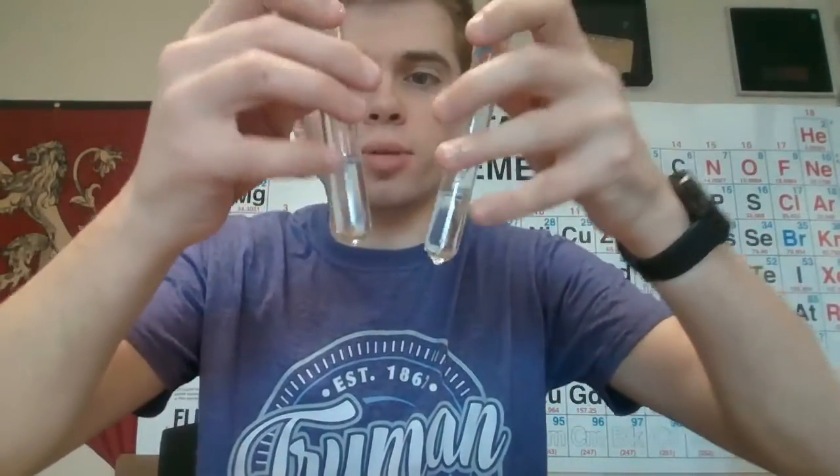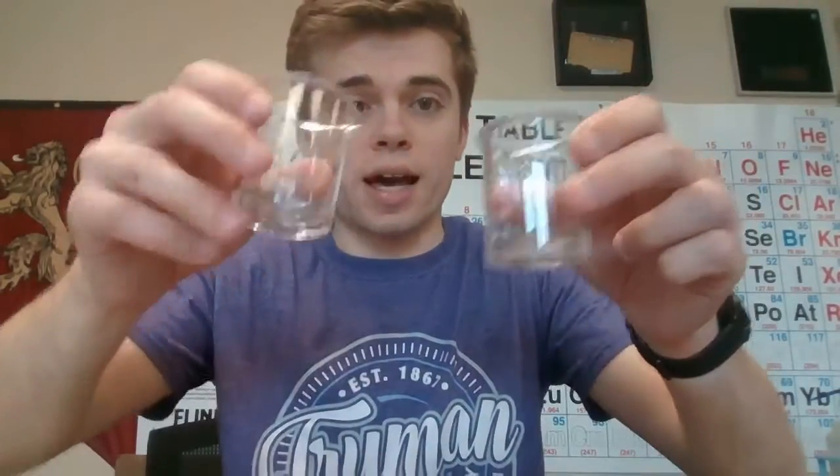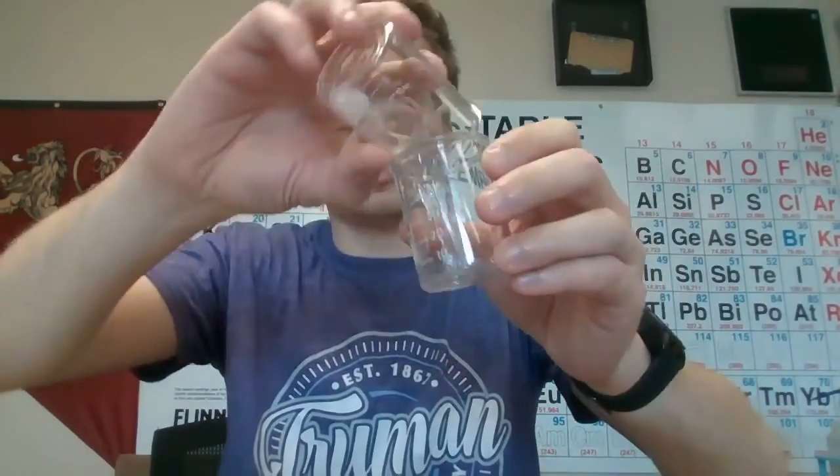Okay, Chem Kids, for our last trial, I've heated these two up to about 35 degrees Celsius. So they're not super hot, but they're a little toasty. I'm going to dump them in their beakers and we're going to do the exact same thing. We're going to mix them together and see how long it takes to turn blue. I'm mixing now. Start those timers. There you go, there you got it. So make sure to record that time. And that is the last data for this trial.